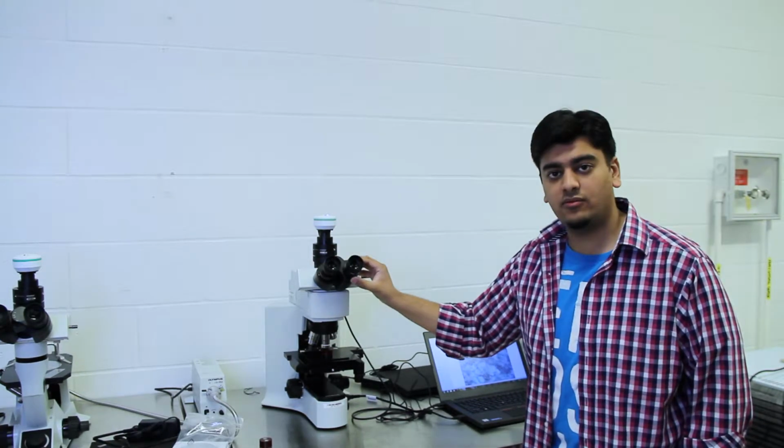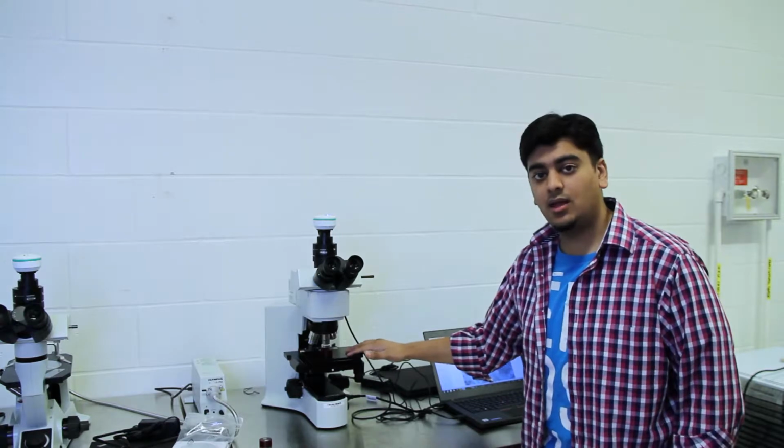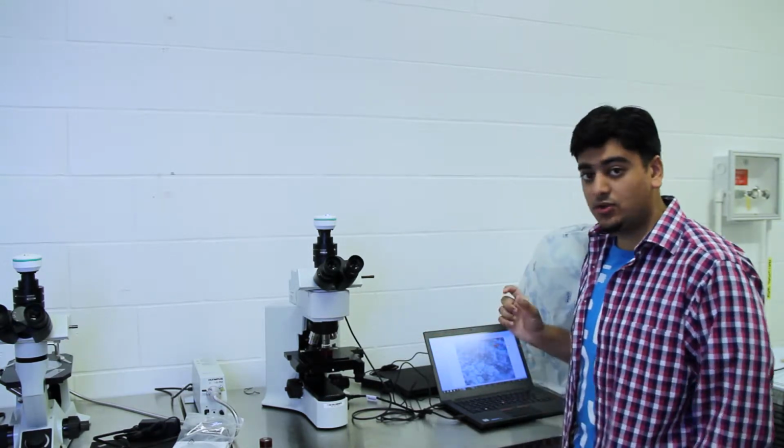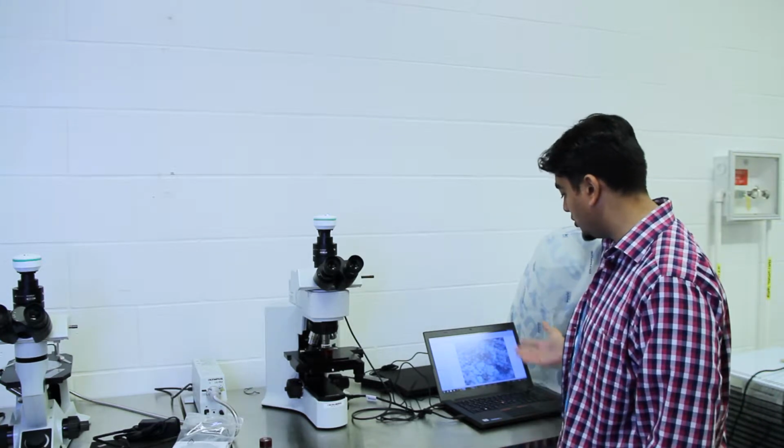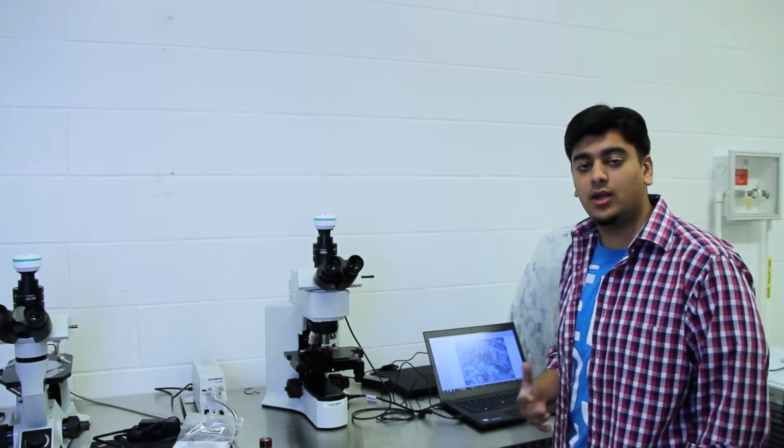So just looking through one of them is perfectly fine. The second thing that you want to keep in mind is that the sample placed here may not be exactly flat to the bed. So as you're focusing it, the live feed will show you that not the entire image is in focus. Only partial parts of the actual frame are in focus and the rest of it is out of focus. So that's why we prefer to use the inverted microscope. So let's take a look at that.